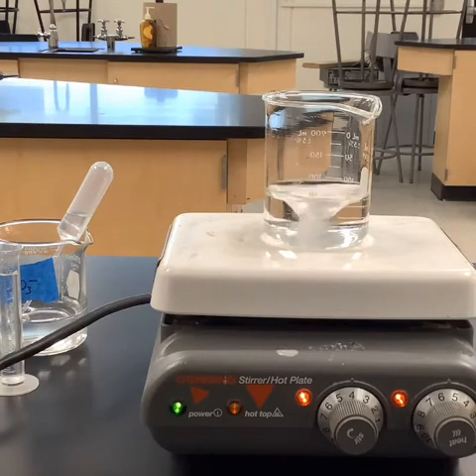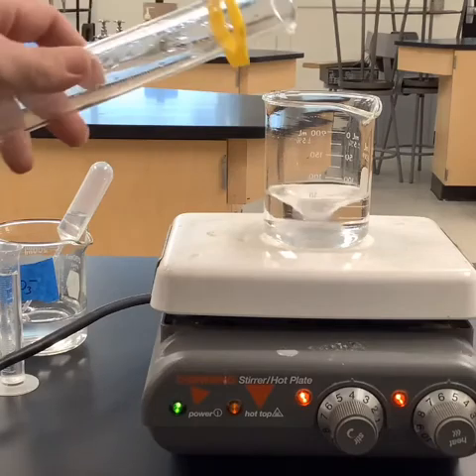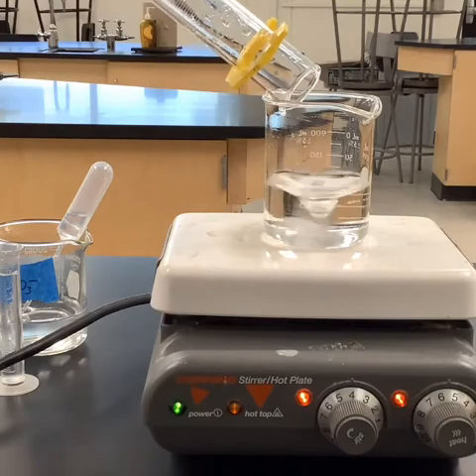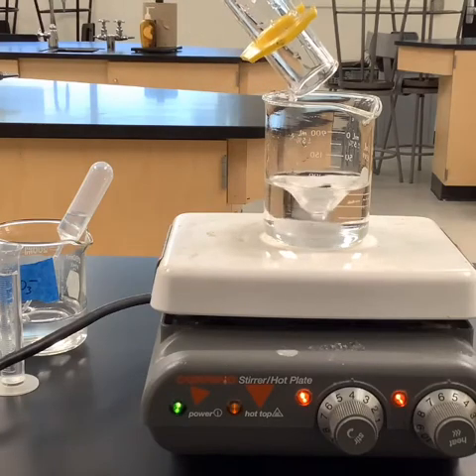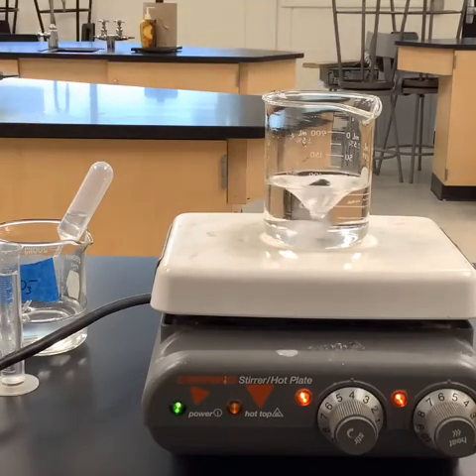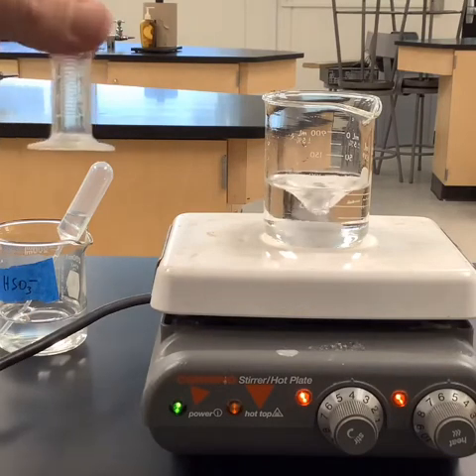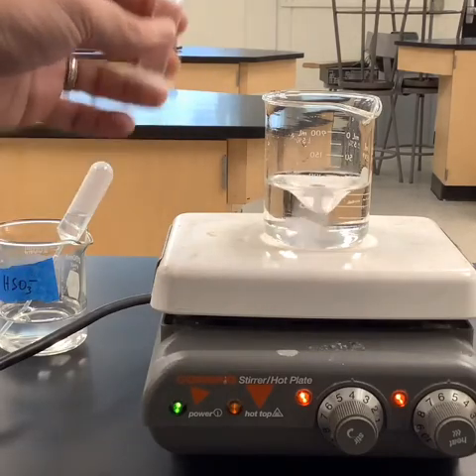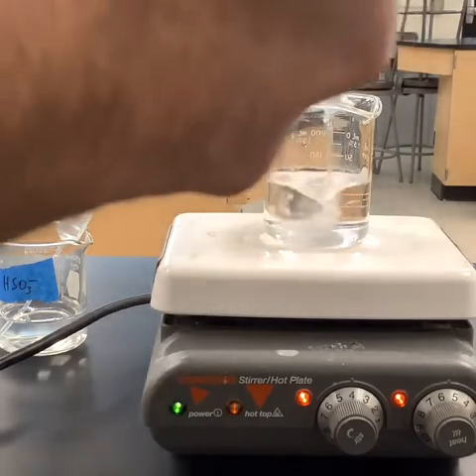So we've got the first one in. We're going to go ahead and put the 20 milliliters of the iodate in. Once again, don't worry, we're not starting yet, not until we get our last chemical in, the second reactant. Remember, this is the same amount as we had last time because this is the one that we're holding constant every single time. So make sure that you guys are paying attention. Are you ready to start? Okay, so we're going to go 1, 2, 3.